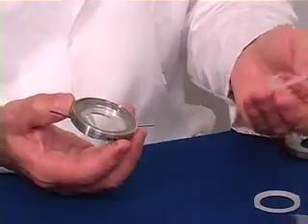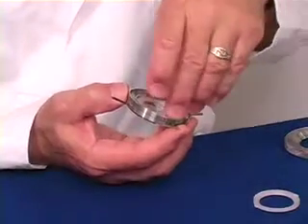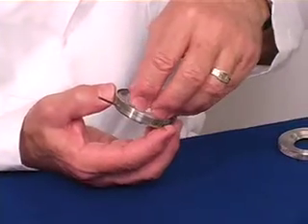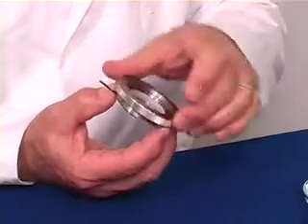You select a gasket of the appropriate geometry — in this case, a round gasket. You then place your cover slip on top with the cells. There's a little pressure piece that fits on that prevents any rotational forces from the top from being transmitted into the glass, so that even DIC imaging will not be affected. Then the top fits on — it simply screws in place like this.